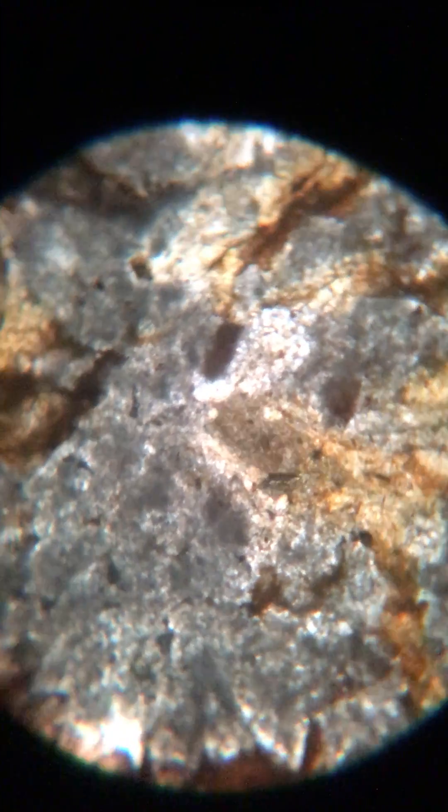In some sections we don't see any interference colors — it's difficult. I want you to look for the shapes and make notes about the whole texture of this. I have some other dolomites to show you later, but I just want to introduce you to a variety of things. Again, this sample is SM43, which is dolomite, and you should be able to see some of the rhombs in here.